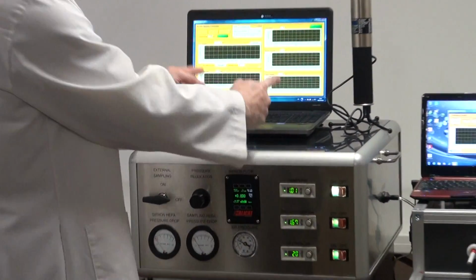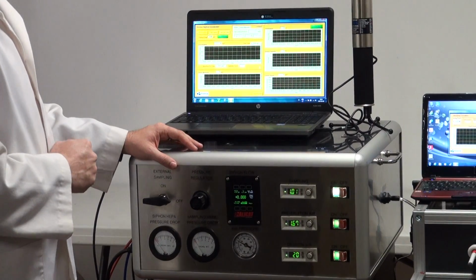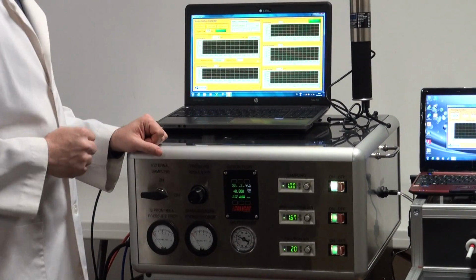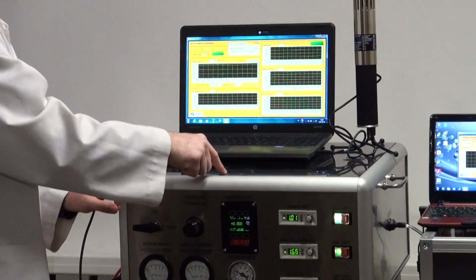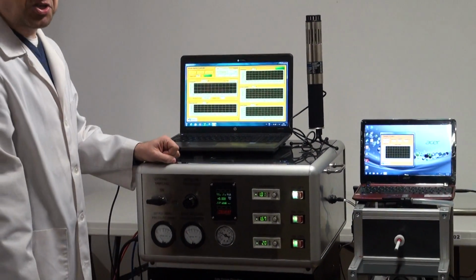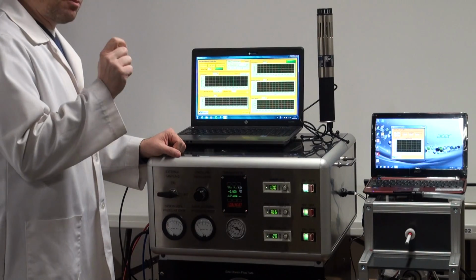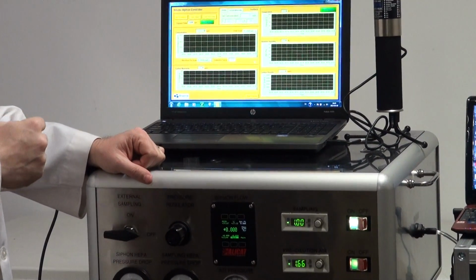After that, in between the two mixing jars, there is a vacuum mass flow controller. When we set the concentration that we want the siphon to generate, the aerosol monitor inside the box measures the concentration at the outlet of the siphon and sends the signal back to the control unit, which compares that to the set concentration and commands the mass flow controller to siphon off part of the pre-diluted mainstream smoke in order to bring down the concentration to the set concentration.